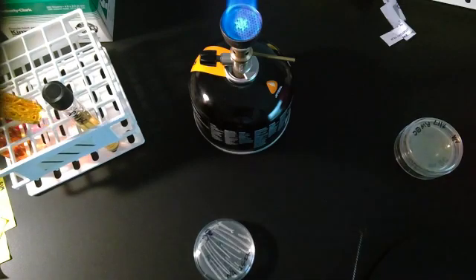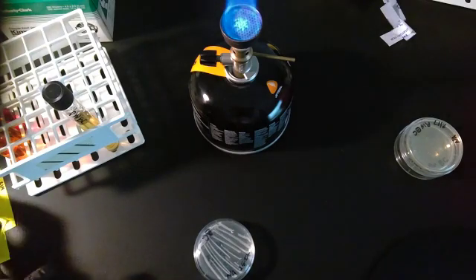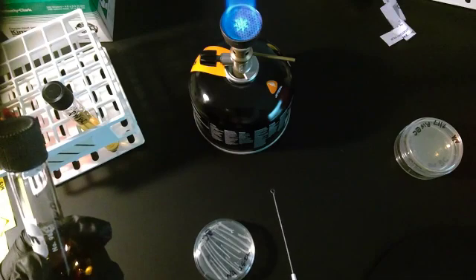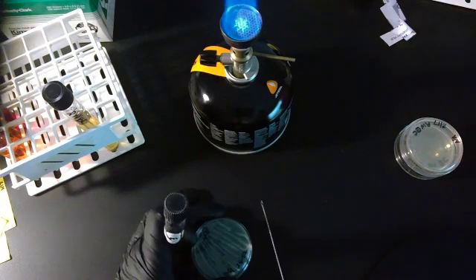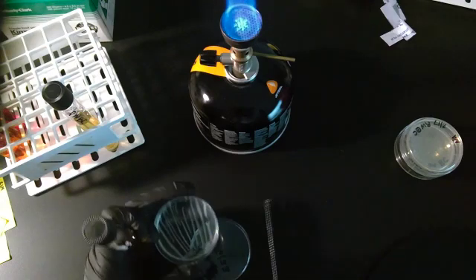Last liquid media is the Maltose Tube. Just as a reminder, the reason that we are using 4 different sugars is because depending on which bacteria you have, it may or may not eat this particular sugar or ferment this type of sugar. If it does, you get a change in the phenol color. Instead of being red, it turns yellow.